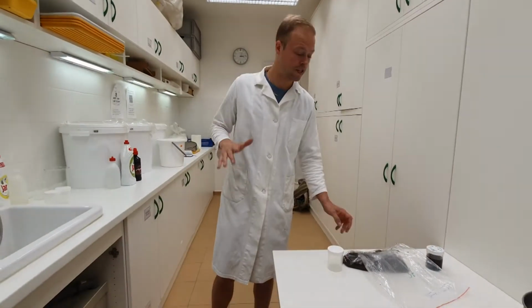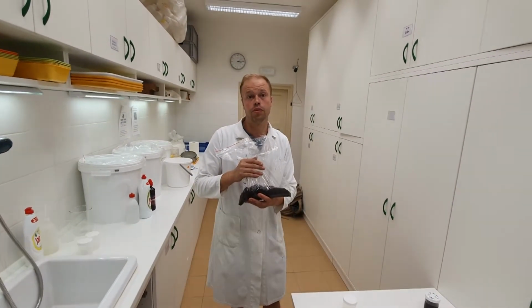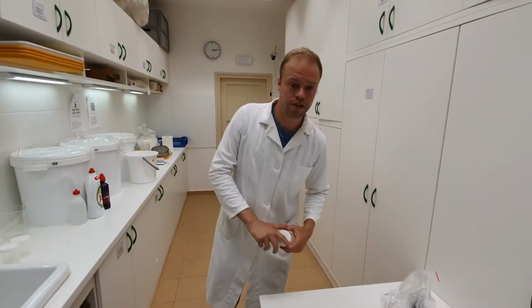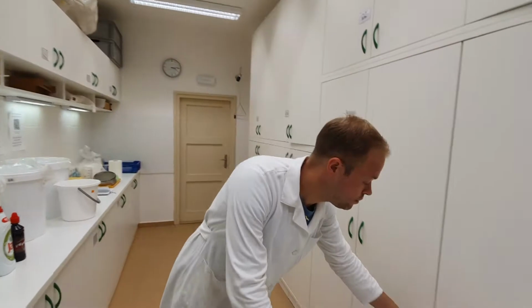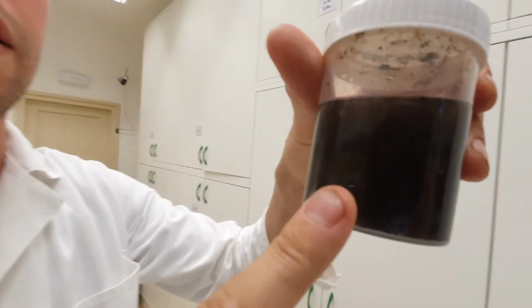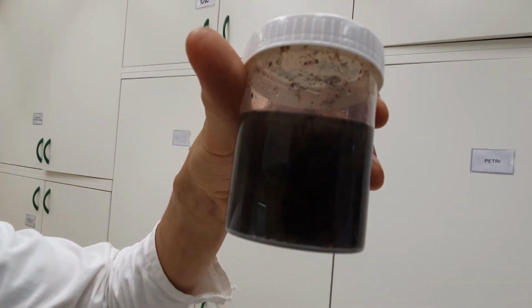And of course you need sediment. I would recommend at least 2 liters of sediment per sample. Then at the end of the procedure, you store your float in some containers. And if everything goes right, then at the end you have the float, hopefully with a lot of insect remains in it, which you then can pick out easily because the volume is much smaller than the whole sample.